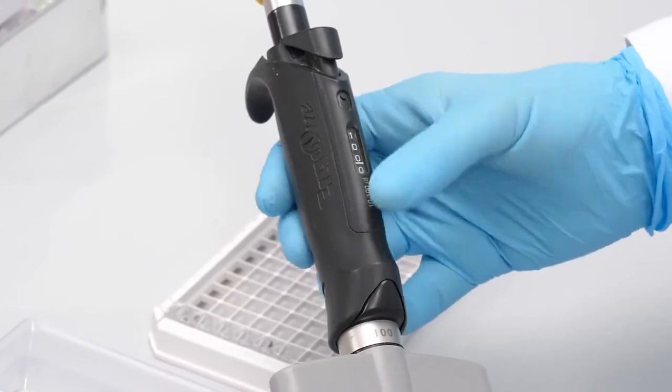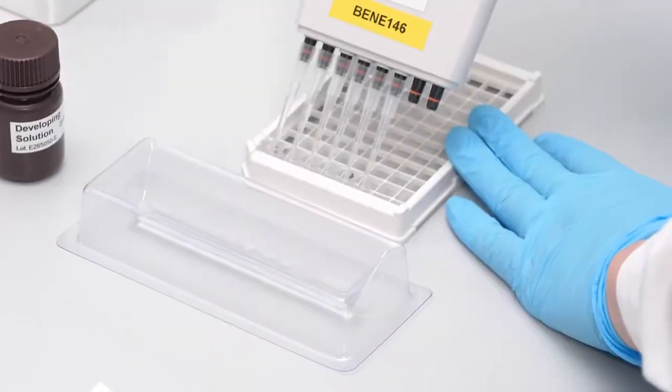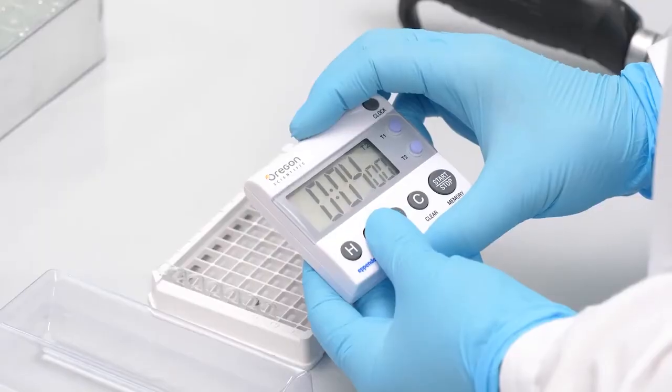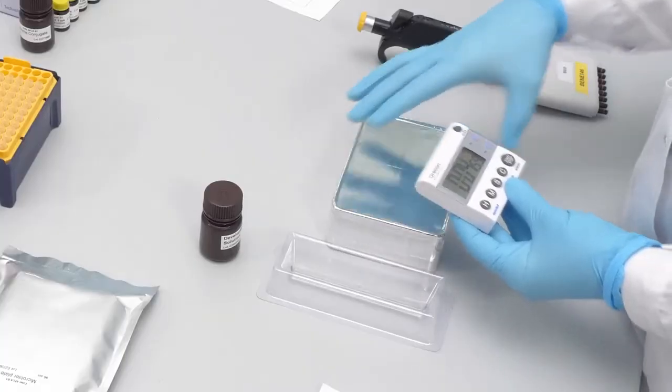Add 100 microliters of developing solution in each well. The solution is colorless and must be protected from direct light. Incubate the assay for five minutes at room temperature.